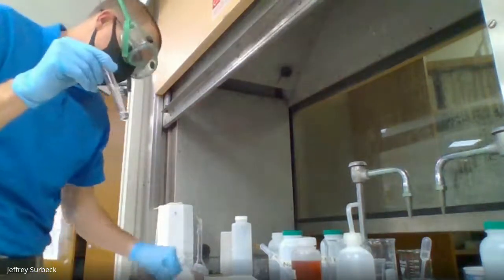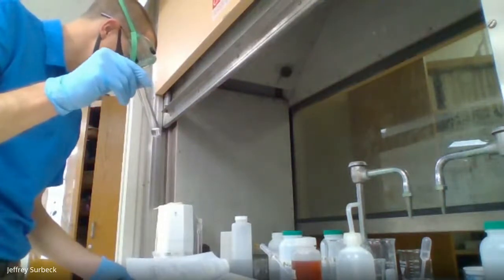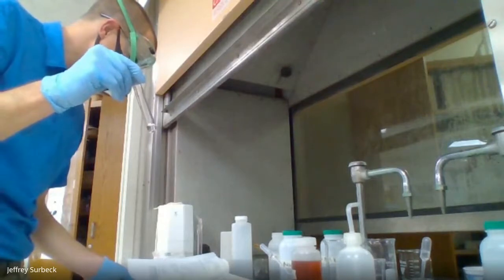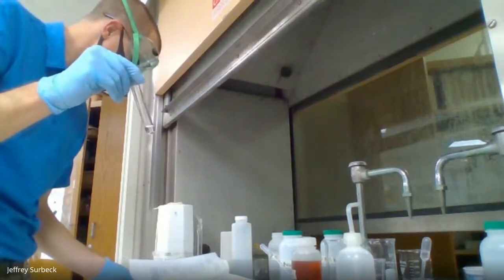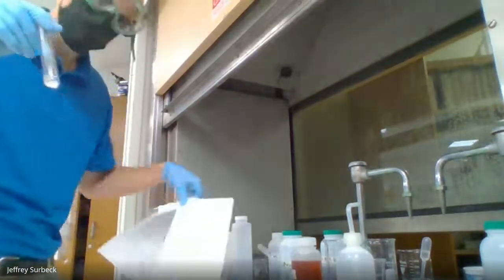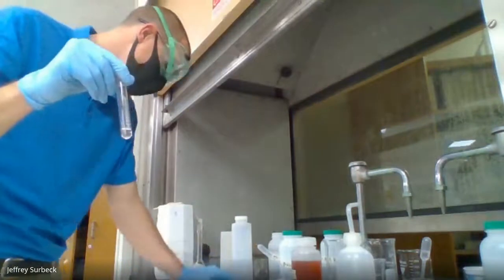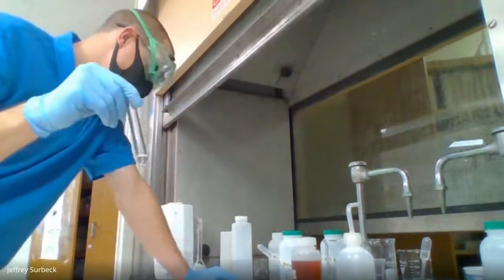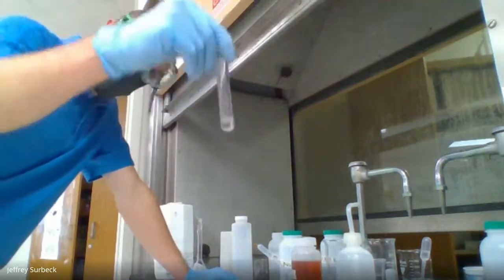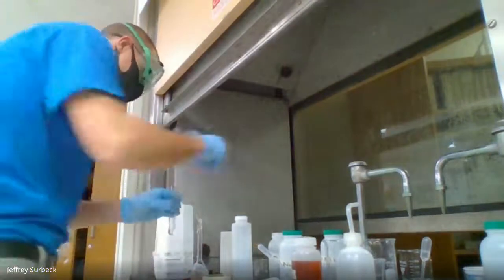So what we are going to do now for our next step, if you flip the page here to step number 6, is we are going to, in page number 6, make sure I got the directions right here, we are going to add 0.1 molar hydrochloric acid to our test tube until we observe a change, okay?